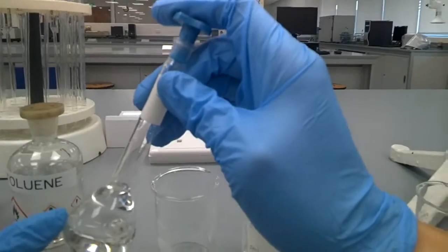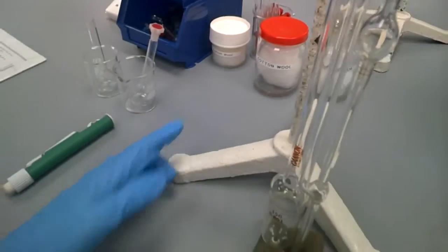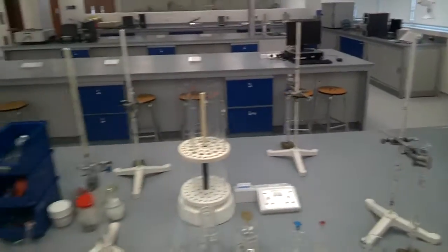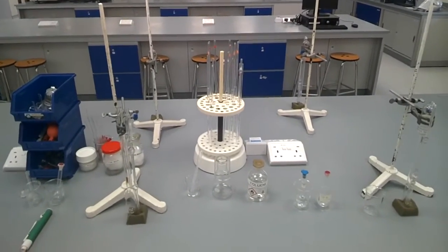So here it is, the setup for measuring the viscosity of a polymer solution. See you.